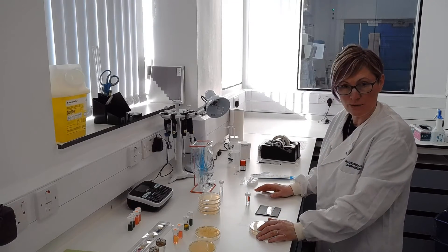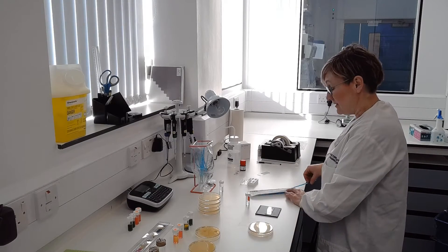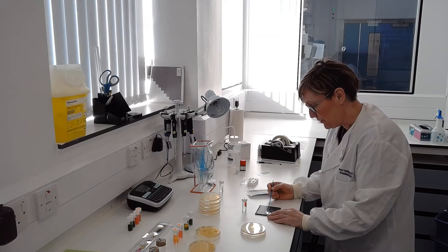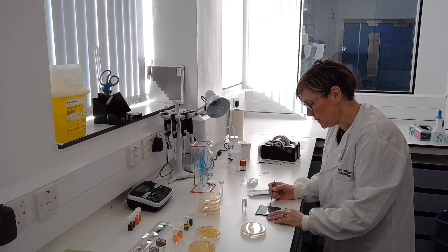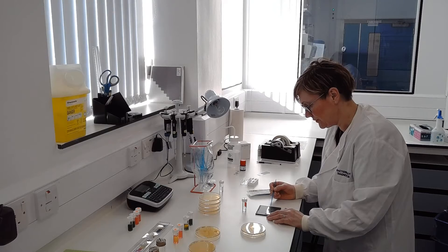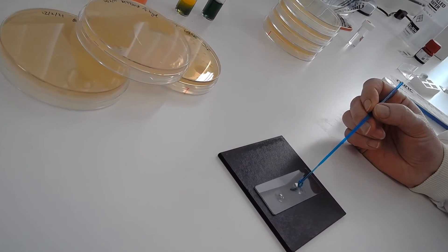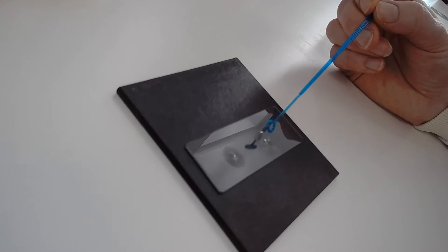Another very rapid test that we check is a catalase test. Again, this is an enzyme, and if my bacteria contains the enzyme, it will break down the hydrogen peroxide on the slide to produce oxygen bubbles. I take some of my culture, mix it with the hydrogen peroxide, and you can see bubbles appearing in the liquid underneath the loop where I've added the bacterial culture. It's not very dramatic, but we can see that oxygen is being released from the hydrogen peroxide.